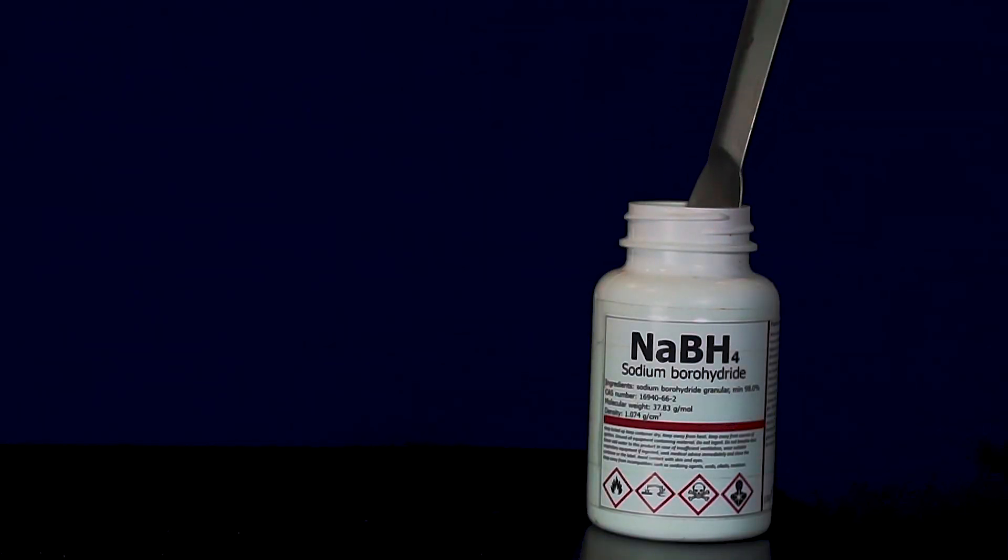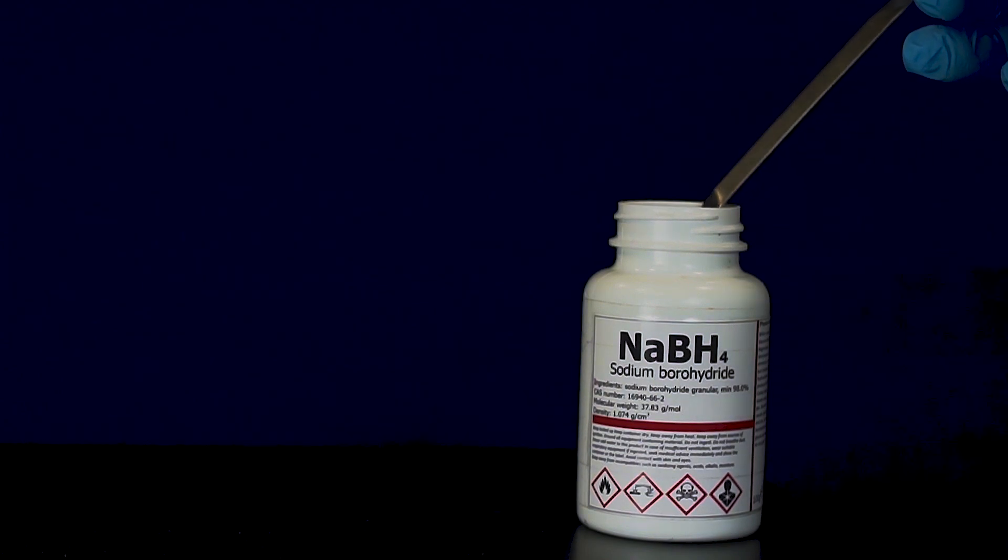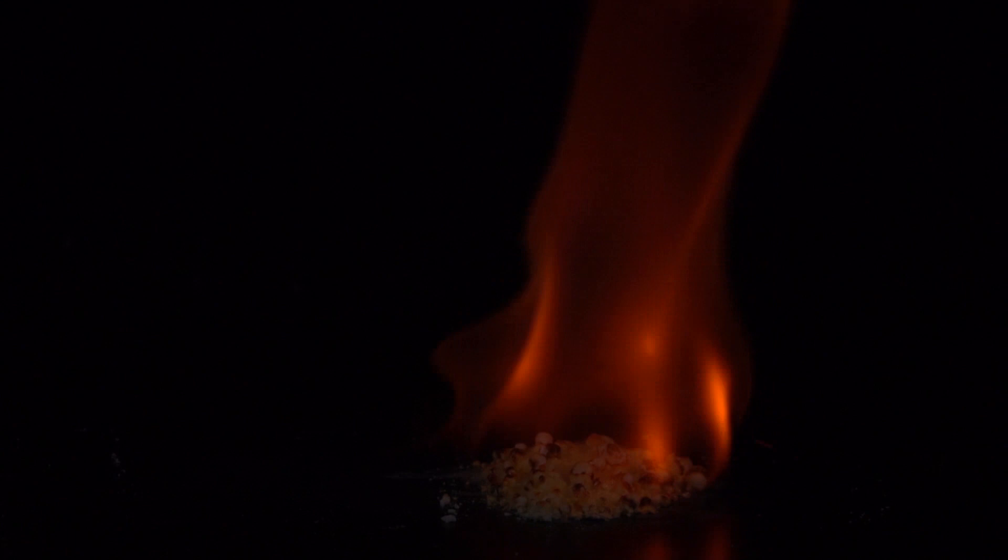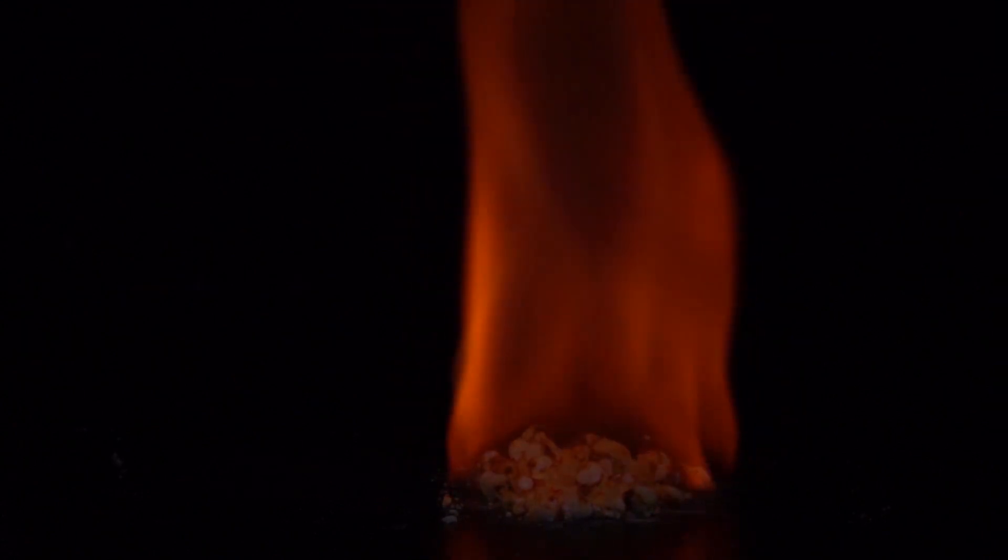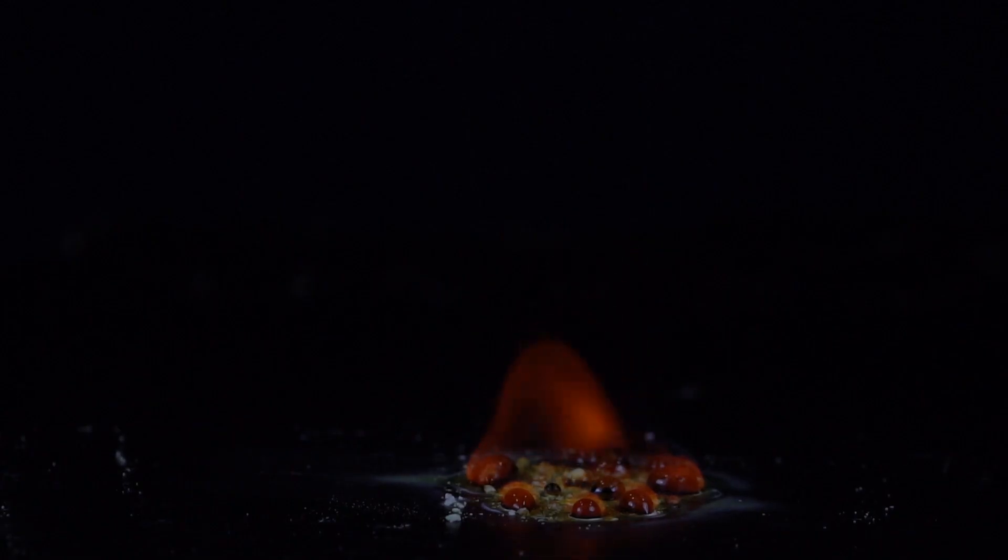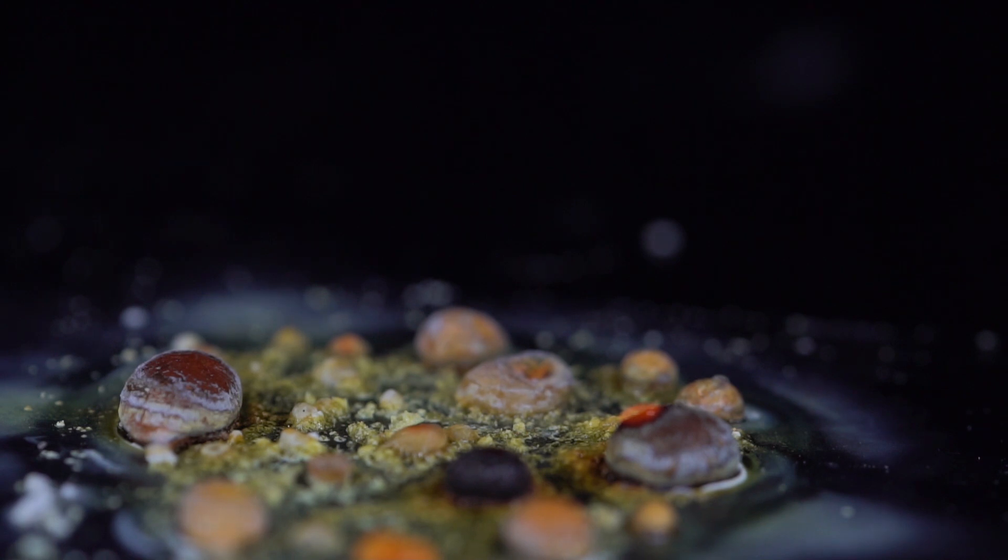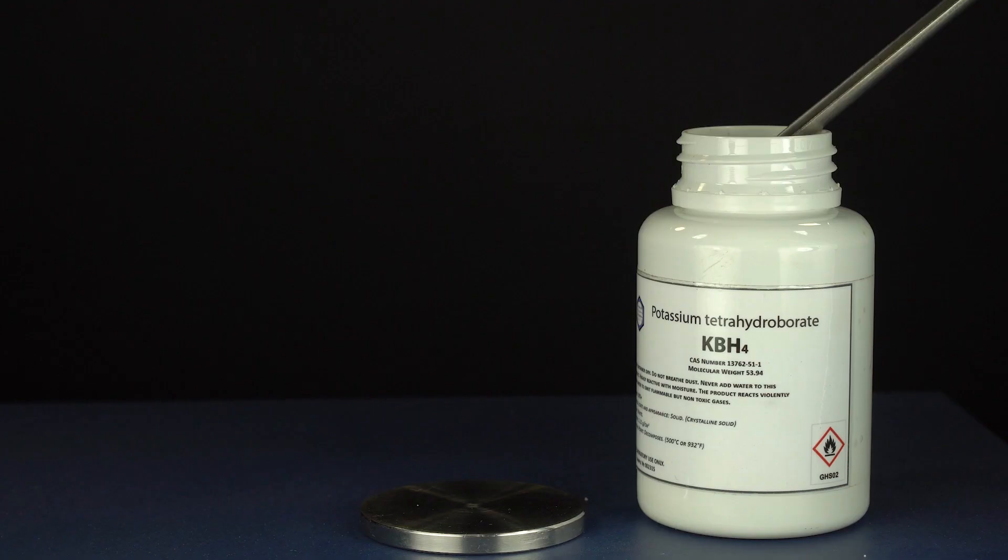The main component we need to get diborane is sodium borohydride. Sodium borohydride easily ignites and burns smoothly. Potassium borohydride acts exactly the same way.